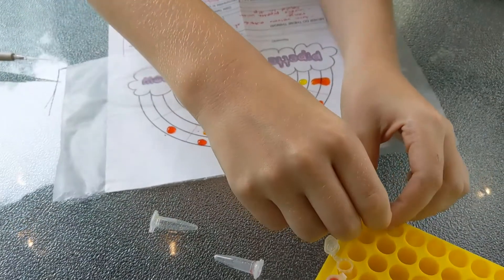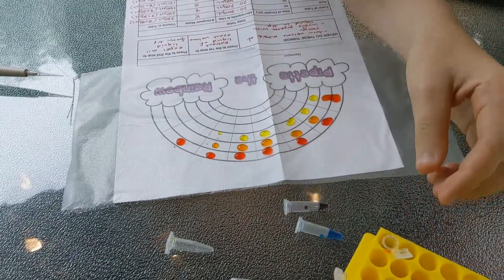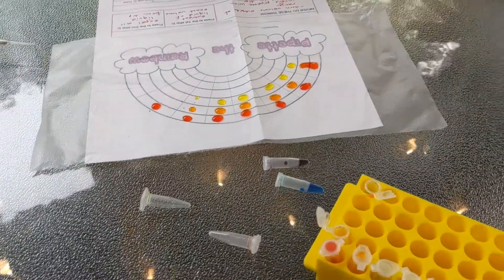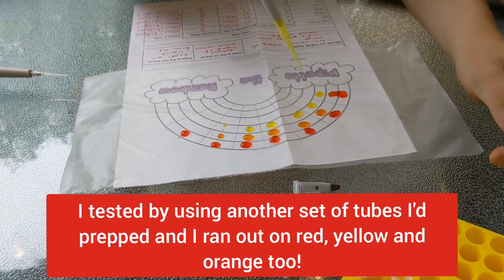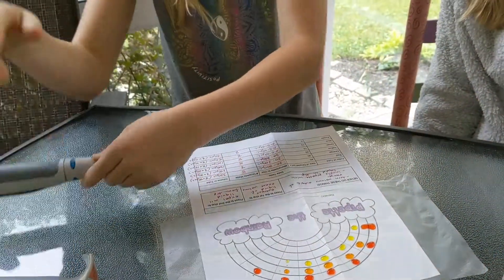So we're three for three — none of them were able to make enough droplets, which means the teacher is going to have to retry and make sure the lab was set up right. Lily's going to continue with green — but which pipette are you supposed to use for green?